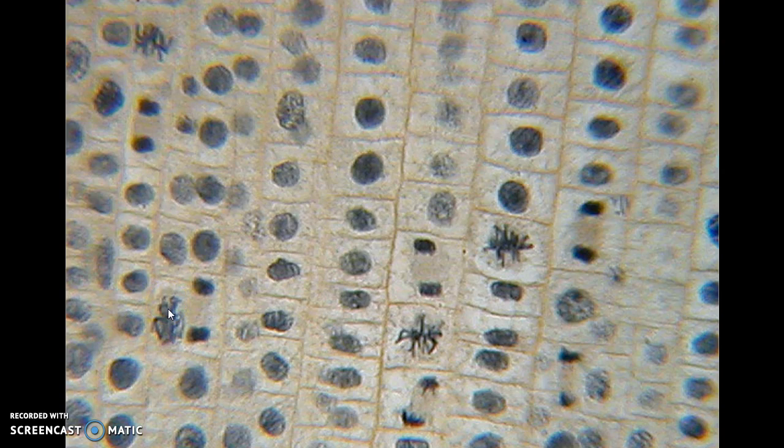is the process of mitosis, which is the scientific word for cell division, which means that we actually are having the cells multiply. So we start out with a cell where the nucleus is intact, and then the nucleus starts to separate, like over here, and the nucleus is starting to split apart. Eventually we'll reach a point where we end up with two nuclei in the same cell. They're a little smaller than normal, and then eventually that is going to get split apart and we're going to have two cells. So the cells are dividing, and again, that's the process of mitosis.